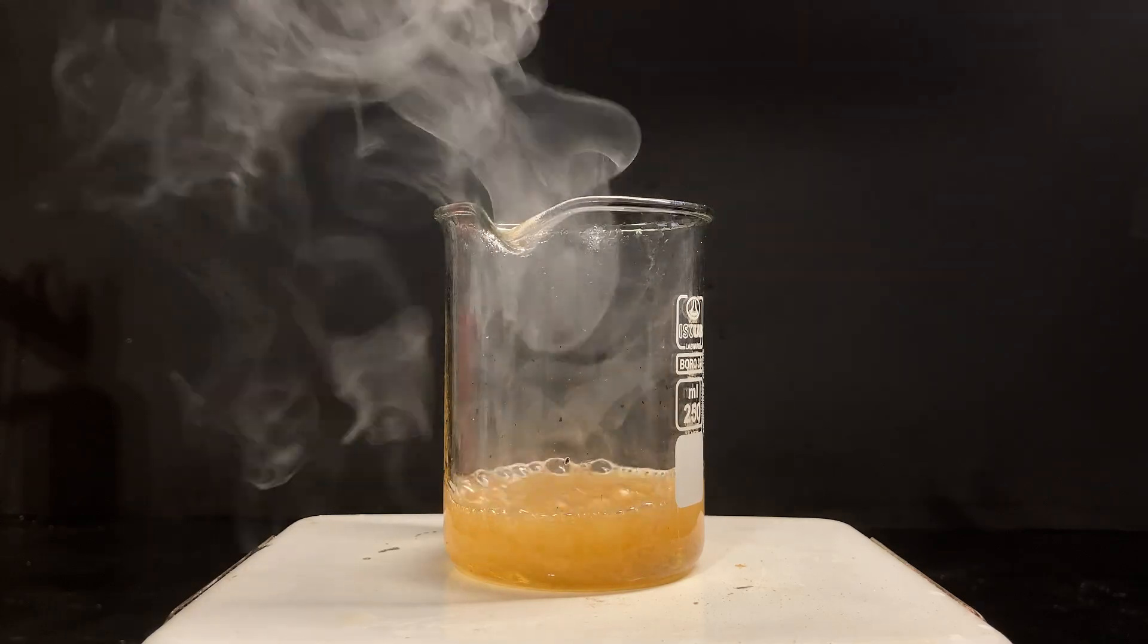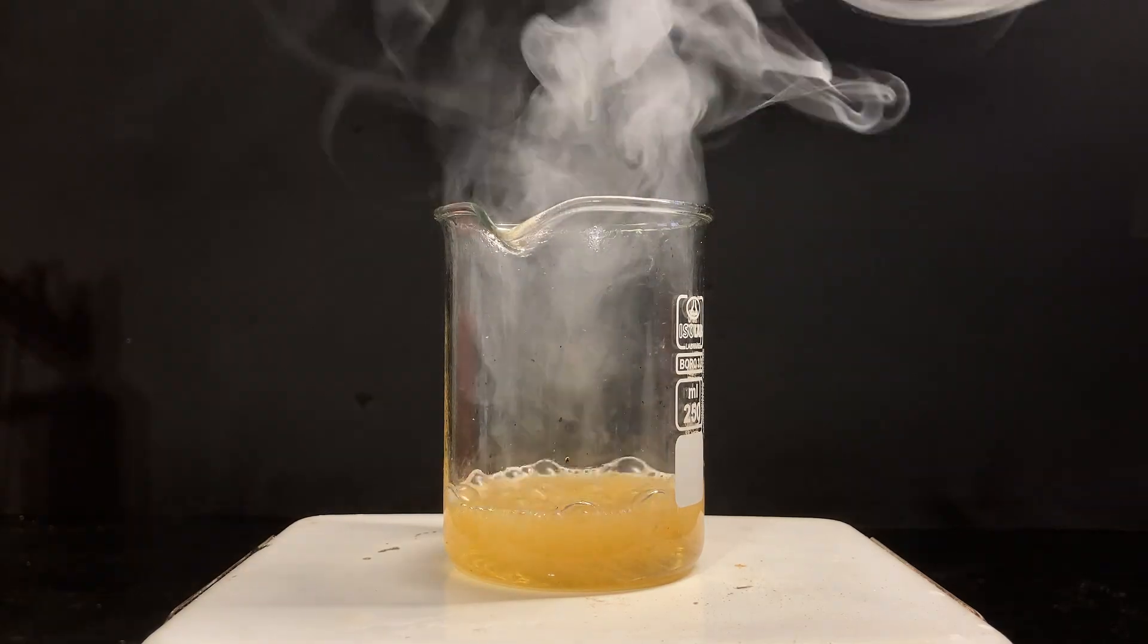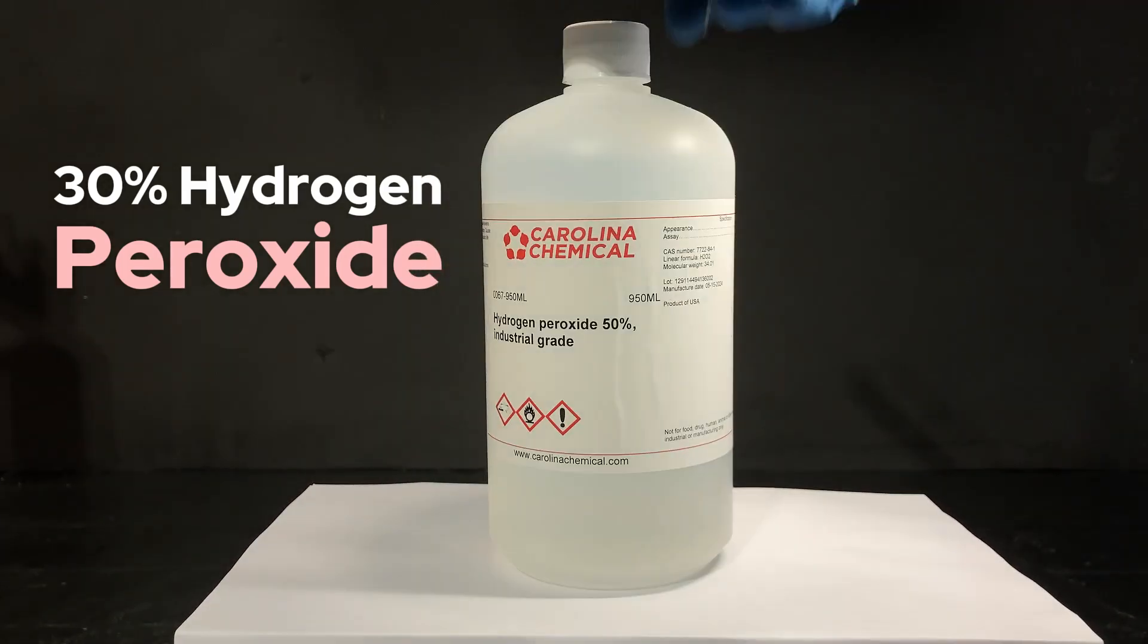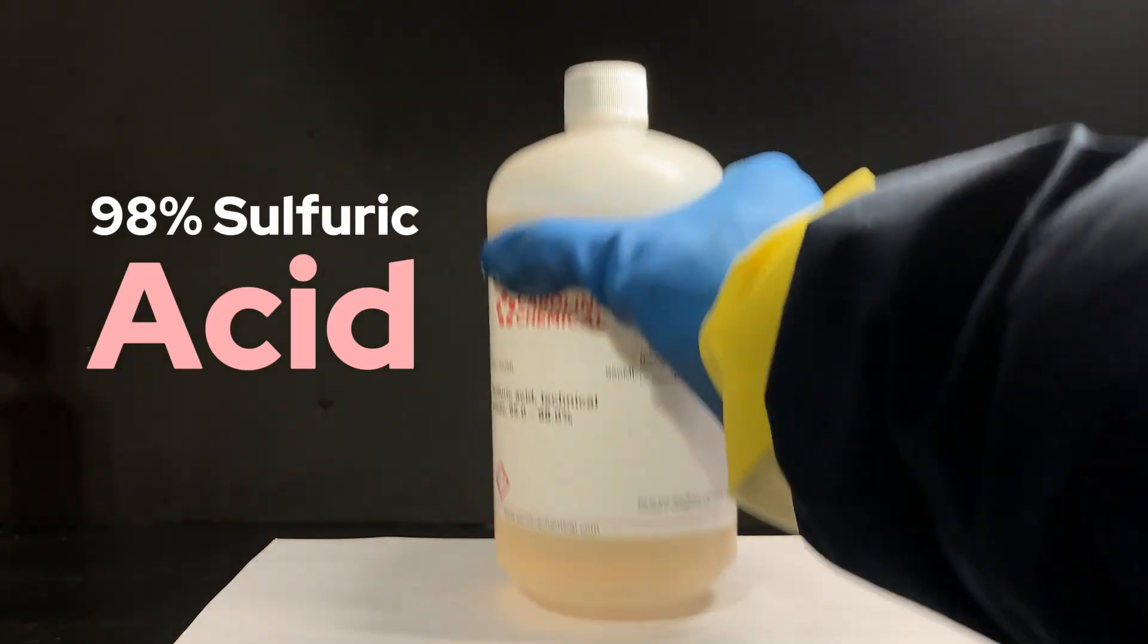Now, the solution is in fact quite easy to make, and it only requires two substances: concentrated hydrogen peroxide and 98% sulfuric acid.